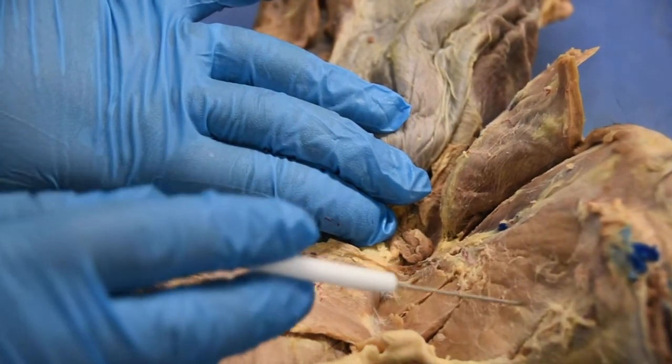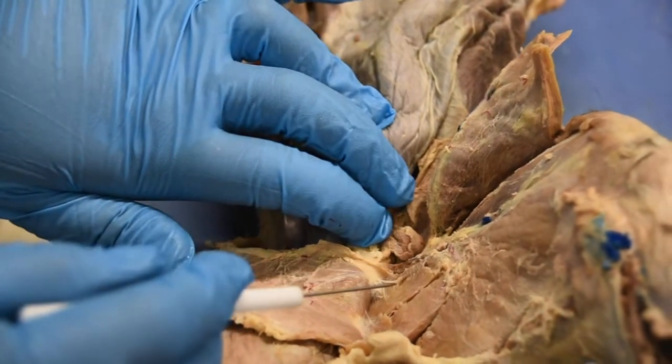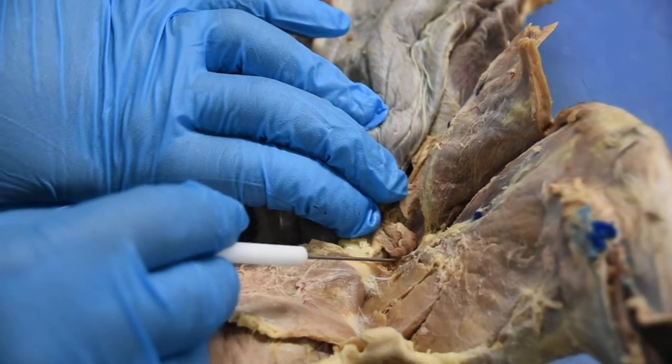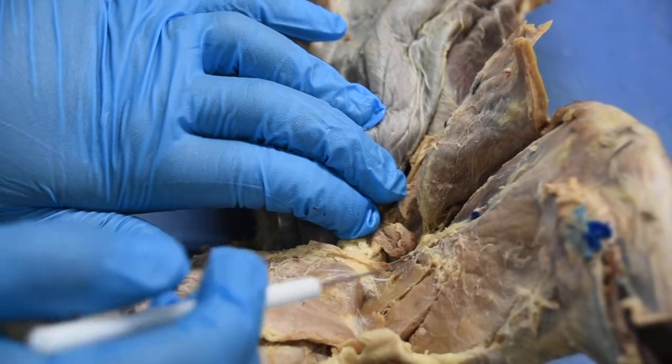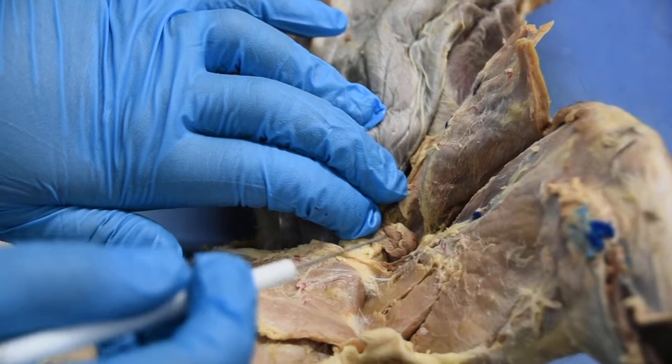They're very similar in terms of order to what we have seen in humans, so the names of the muscles are very similar. Again: pectineus, adductor longus, adductor magnus, semimembranosus, and semitendinosus.